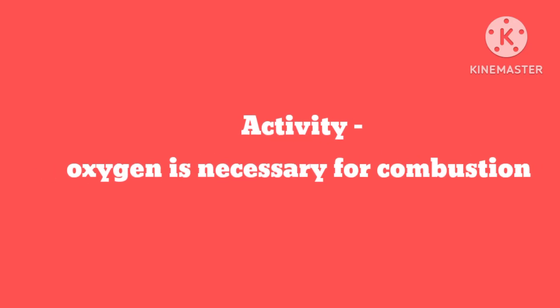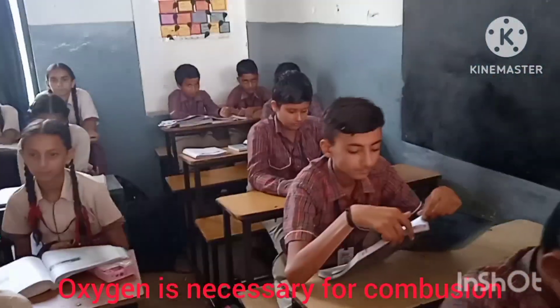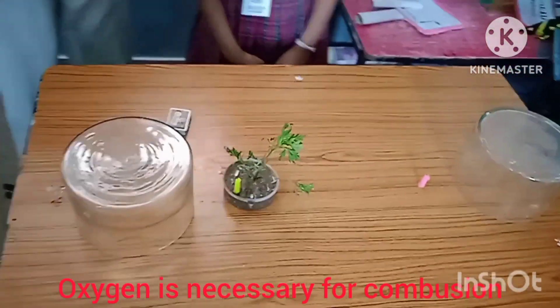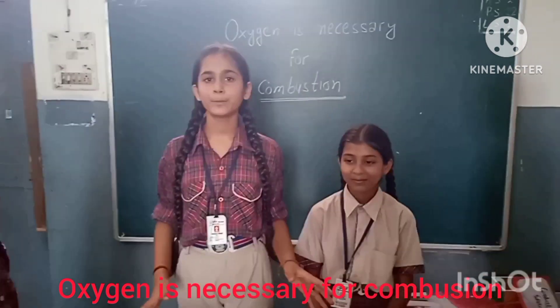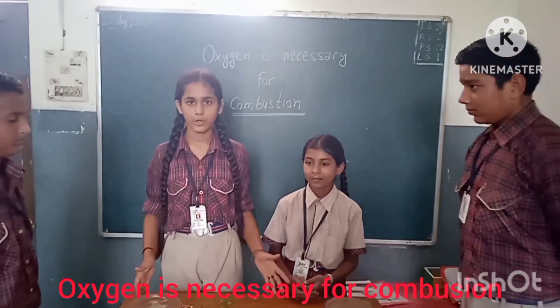Today we are going to perform an activity to demonstrate that oxygen is necessary for combustion.